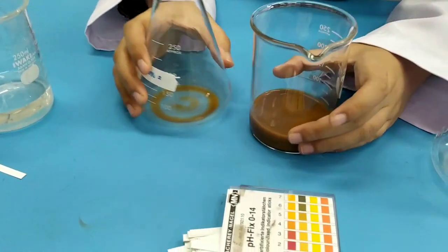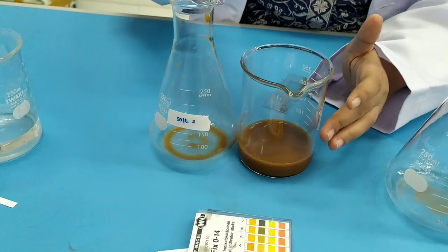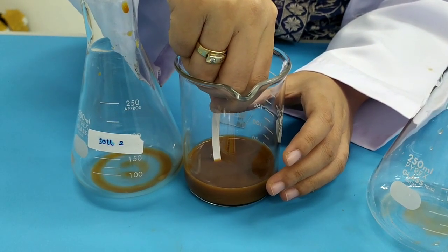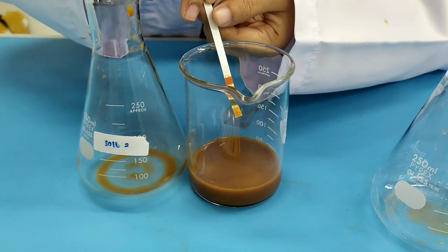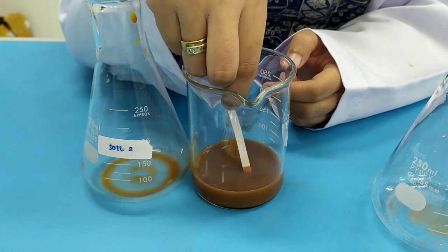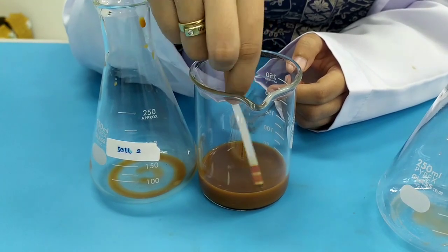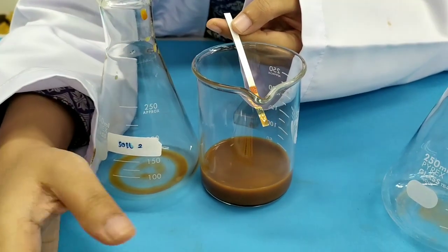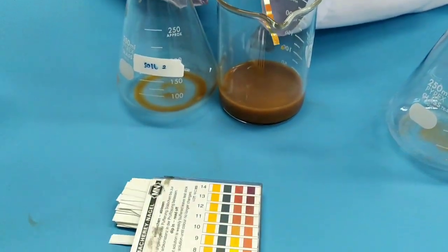And then we will go to soil two. We will just take one strip of pH paper and dip it here. The color is very different. I think it's already changed. And then we will compare it with each value from the box.